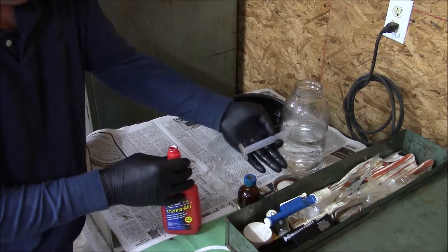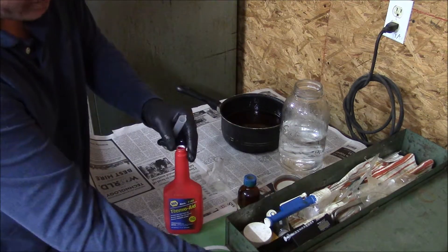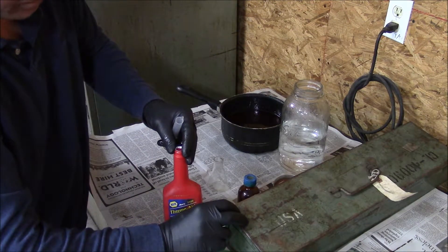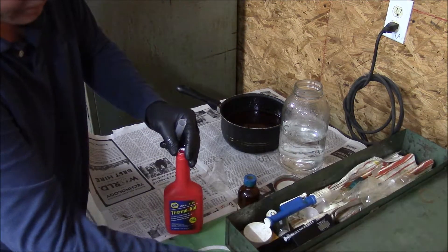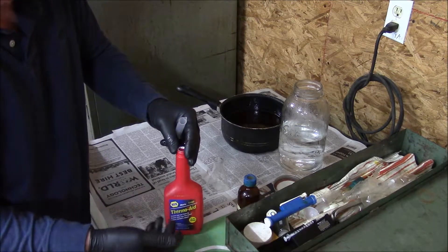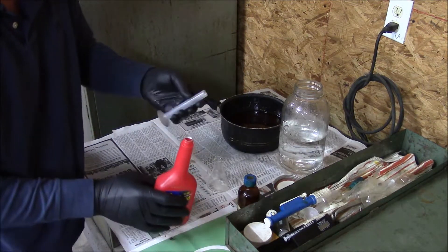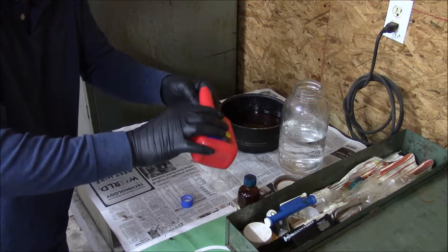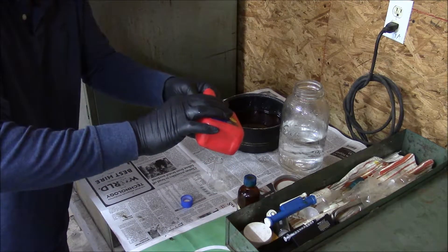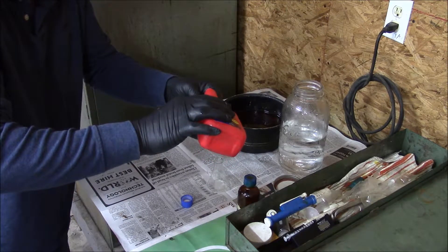Everything that I've got, I believe you can see this in the video. I found this toolbox somewhere and it's been really handy — everything that I need fits in here. When I need to do a titration, I just grab it and it seems to be pretty handy. You'll find some kind of container that will work for you. We'll go ahead and put the 10 milliliters in.